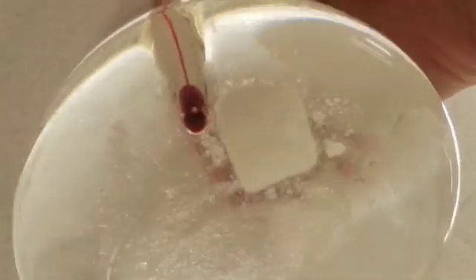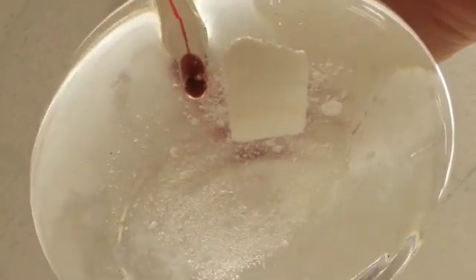So you'll notice this cube is not dissolving fast. It's actually much slower than it used to be. I think we're at number 26 now. So the numbers keep going up. Let's see if 26 is the last one to dissolve.